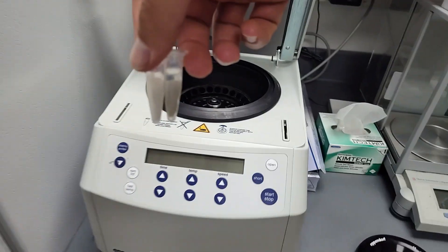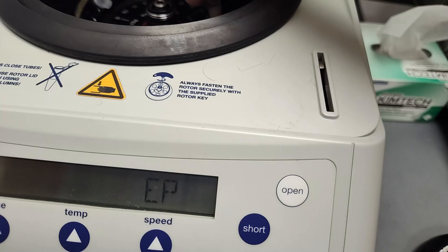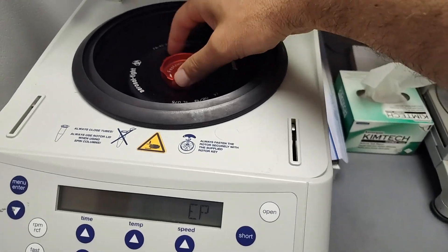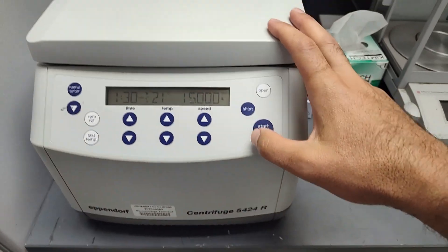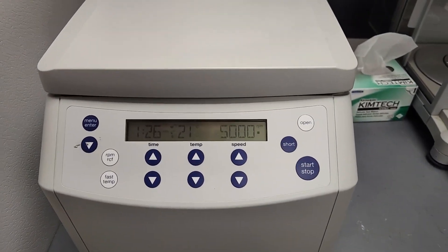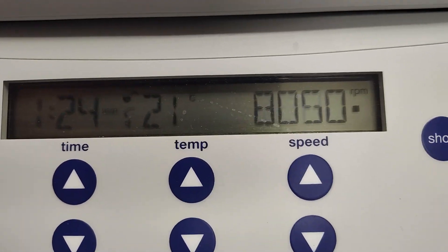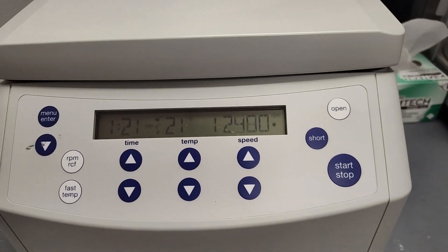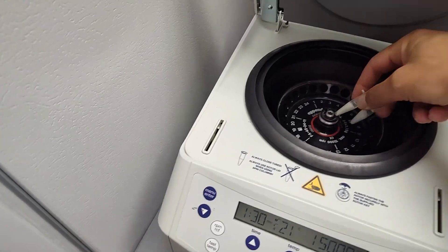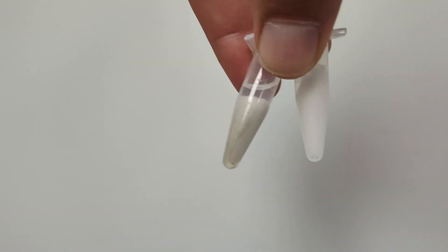I got the solvent in there, but it's tough to extract the bottom because it's a really serious wad of towel. So we're just going to spin it down in the centrifuge — maybe about a minute and a half at 15,000 RPM. We got them off the centrifuge; you can see it's definitely got the liquid down into the solution in the wipe now.